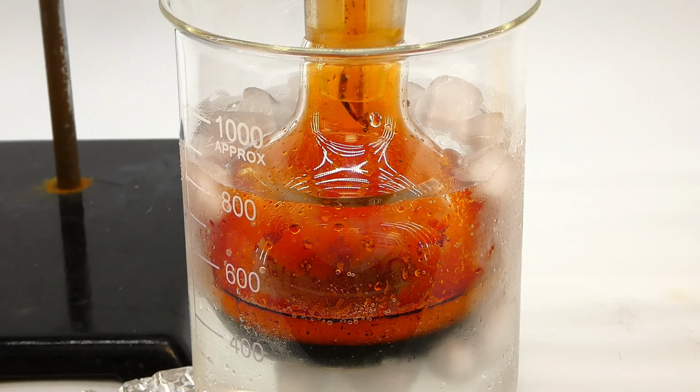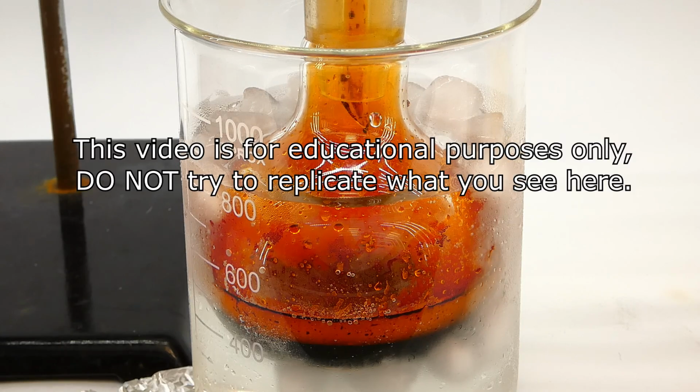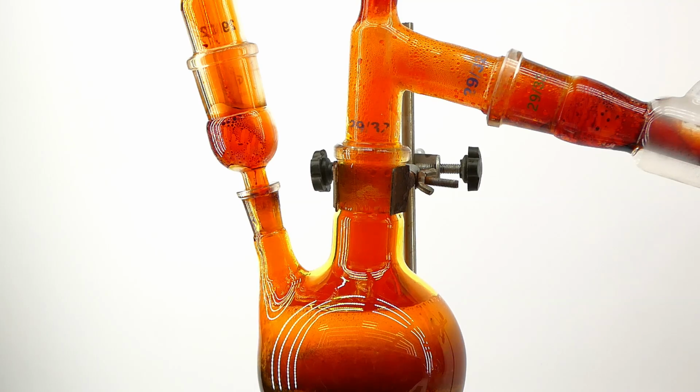Also, before I get a lot of comments asking about this, you can run this reaction with sodium bromide, and you can use dilute drain cleaner acid. You can even substitute potassium permanganate with manganese dioxide that you can get from some batteries. But if you don't want to hurt yourself or your neighbors, please don't try making bromine yourself. Okay, now back to the reaction.